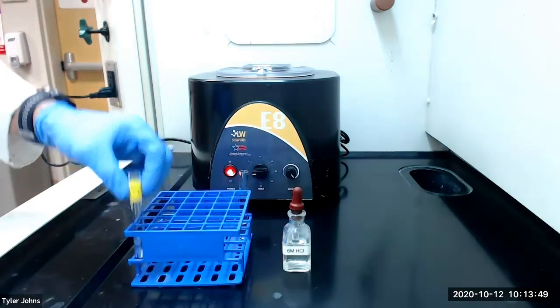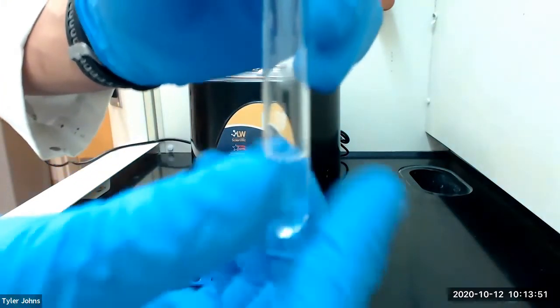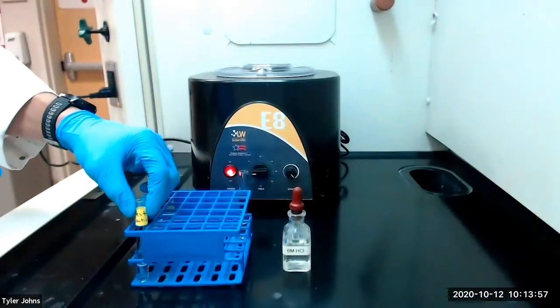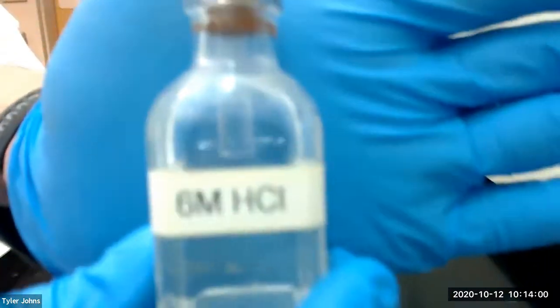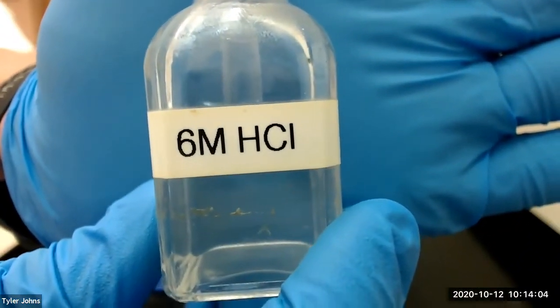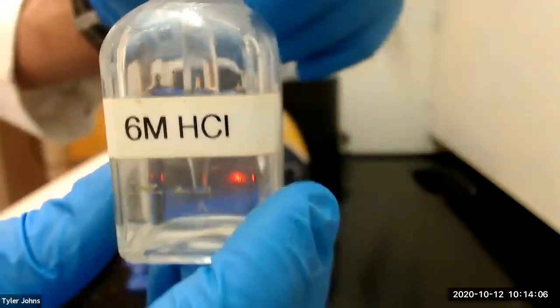We're starting with a test tube with three milliliters of our test solution. We're first going to add three drops of six molar hydrochloric acid to our test solution and we'll mix thoroughly by stirring with a glass stir rod.